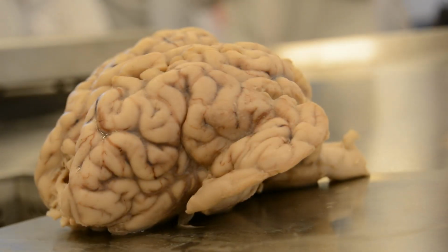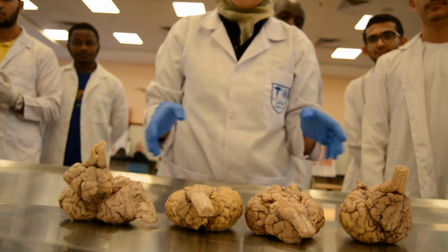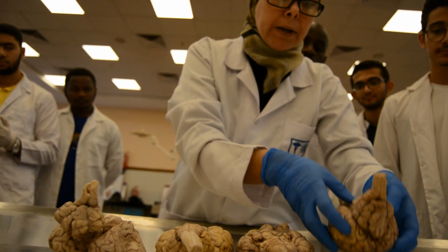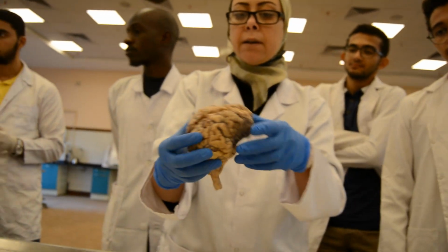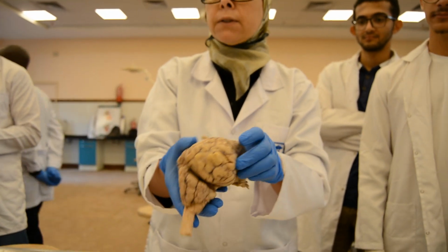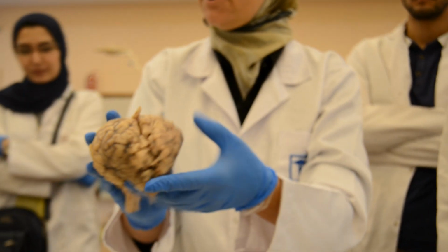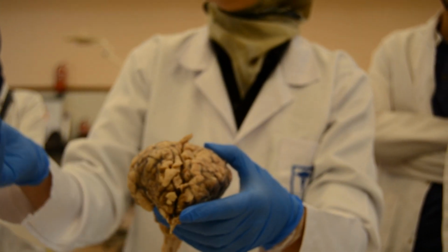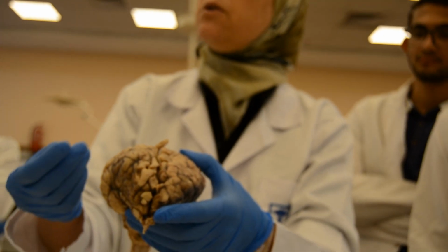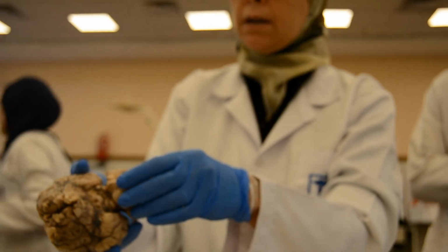Our lab today. First of all, we said that we will undergo the gross inspection of the brain. We'll identify if there is a gross pathology from the outside. There are no hemorrhages. The arachnoid mater is translucent. There is no opacity, no opacity of meningitis or something like that.